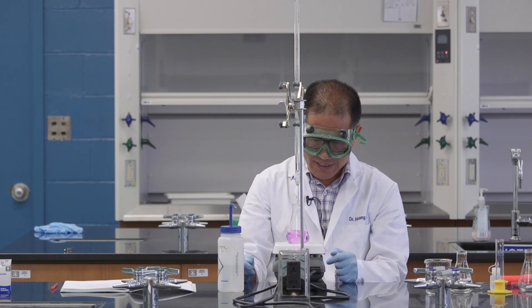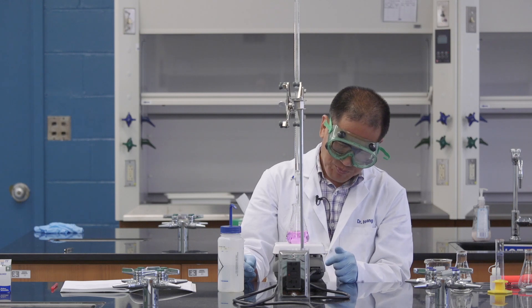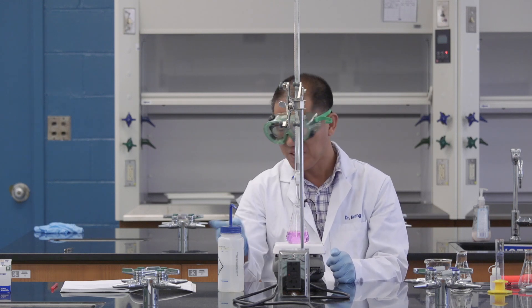I think this color is maybe a little bit too pink. So I will keep the original reading.